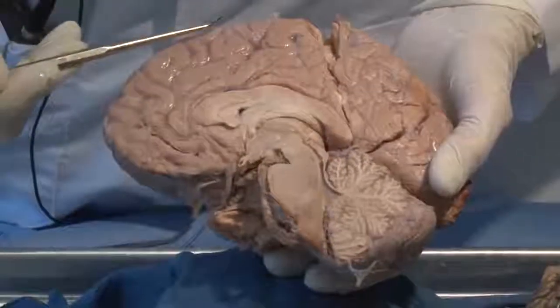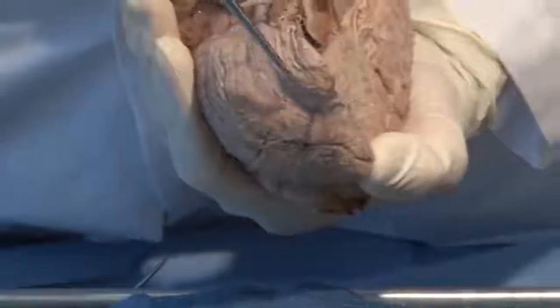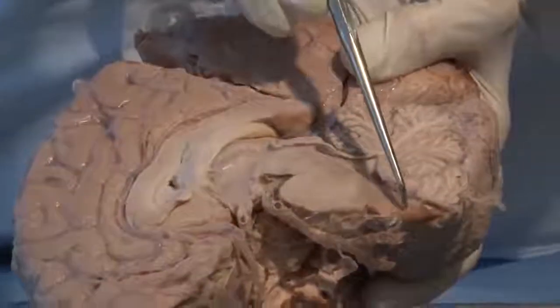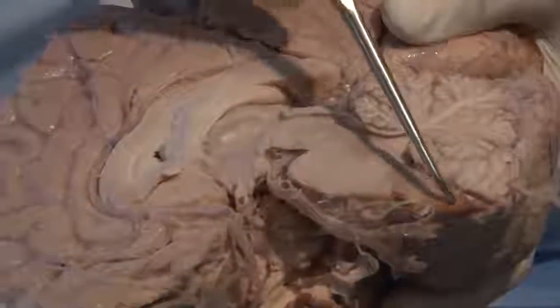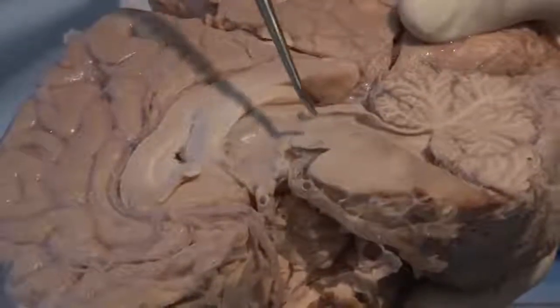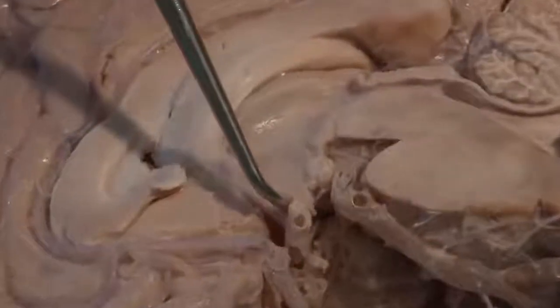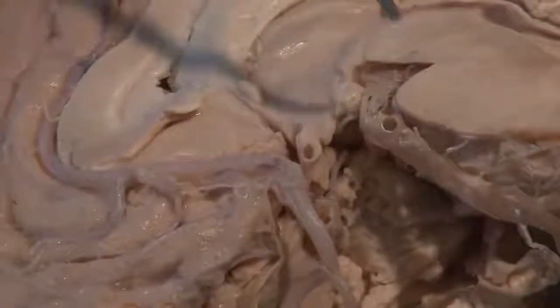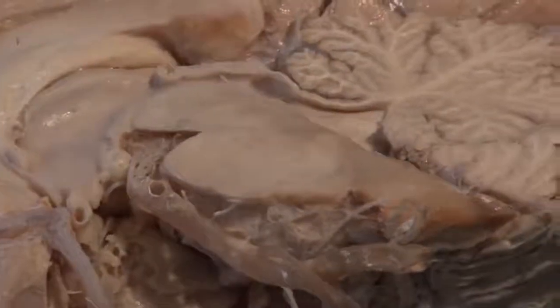The main thing I want you to see on this brain is the brain stem. So this is the cerebellum that we saw before out to the side, and the brainstem, recall, was in the middle. Here we have the brainstem on a mid-sagittal section. This is cut in the middle. Here's a bit of the medulla. Here is the pons with a big basilar artery creeping up over it. And here is the midbrain, often hard to see. And finally, then we have deep structures such as the thalamus. And we can see many of the vessels like the anterior cerebral artery here, as well as spaces such as the ventricular system, which we'll look at in more detail.